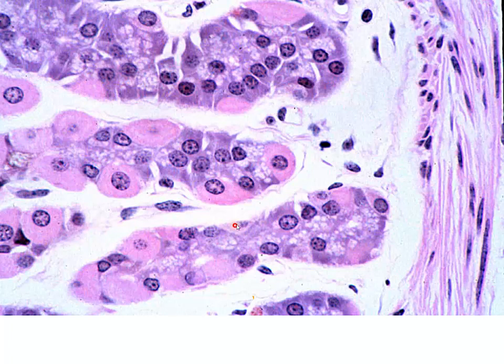Now, in this particular illustration, I'm having a difficult time picking out any that I would classify as enteroendocrine, although this cell looks different. It's not nice and round like we typically see with our parietals. It's not vesiculated like we see with our chief cells, so likely that's going to be an enteroendocrine, possibly an enteroendocrine here.